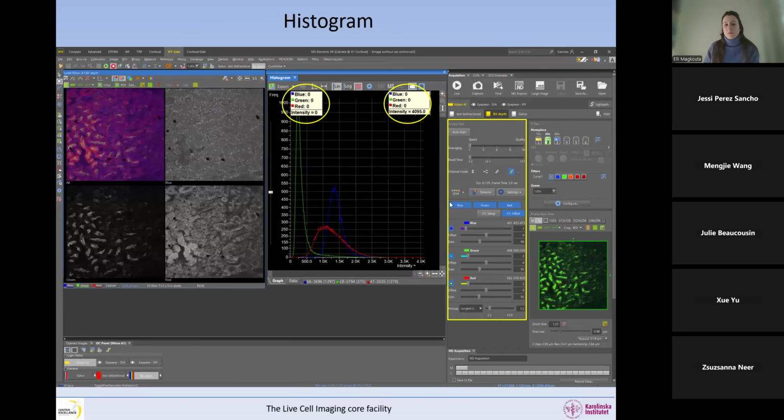So now you can see that if I change my parameters here, and we'll see later what can be done, suddenly I have an image that is well exposed. So I have no pixels that have an intensity 0, no pixels that have a maximum intensity. And you can see that the image looks gray here. So there is some autofluorescence in the background in these two channels. But the peaks are shifted towards the middle, let's say, and we have avoided both saturation and underexposure. So this is a perfectly set parameter to acquire this sample.